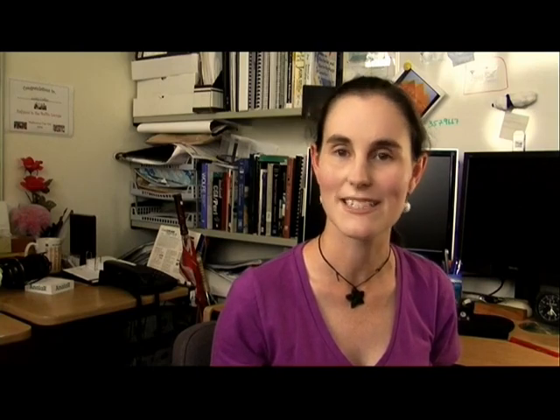PCR replicates in a test tube the process of DNA replication in cells. It was invented by Kary Mullis, winning him a Nobel Prize. The key to his big breakthrough was the discovery that the DNA polymerase from Thermus aquaticus, or Taq, is stable at high temperatures. Thermus aquaticus is a bacterium found in the hot pools of Yellowstone National Park.